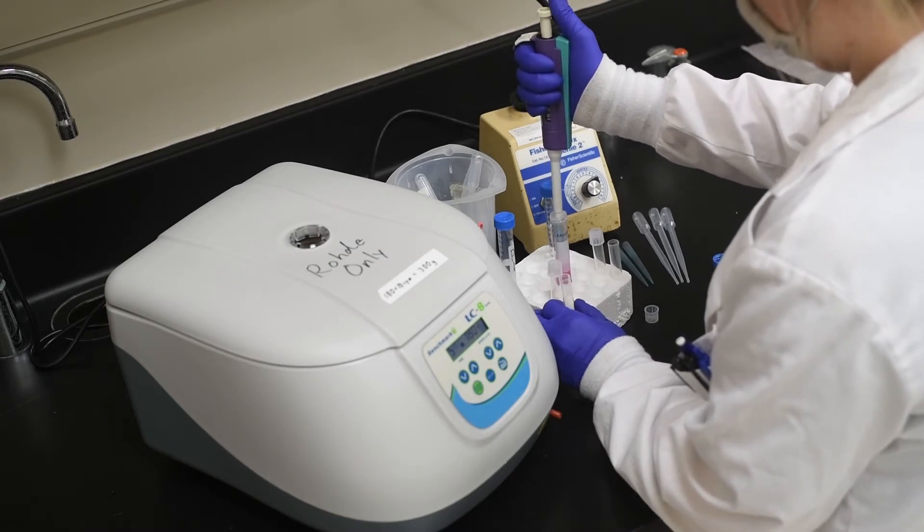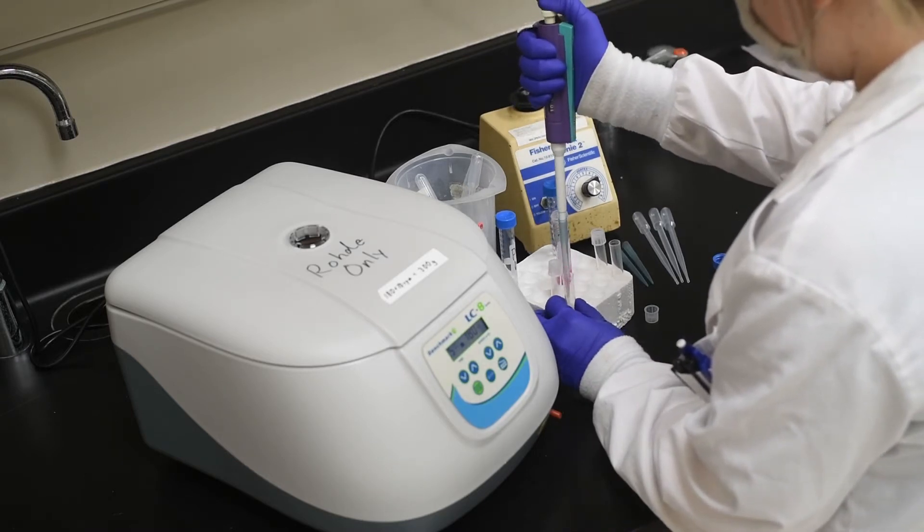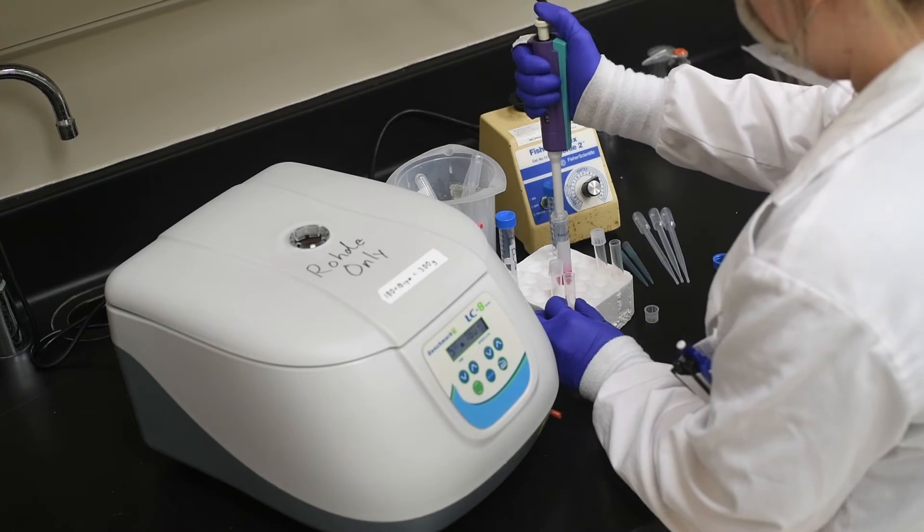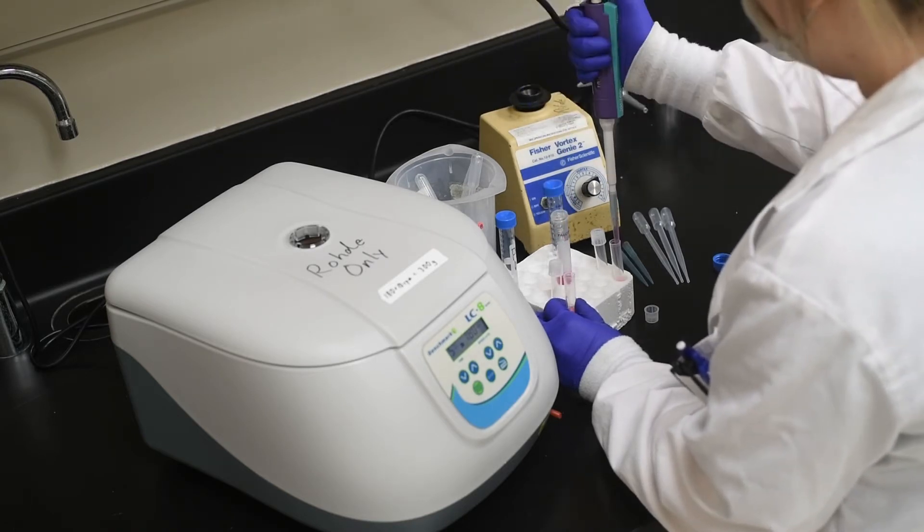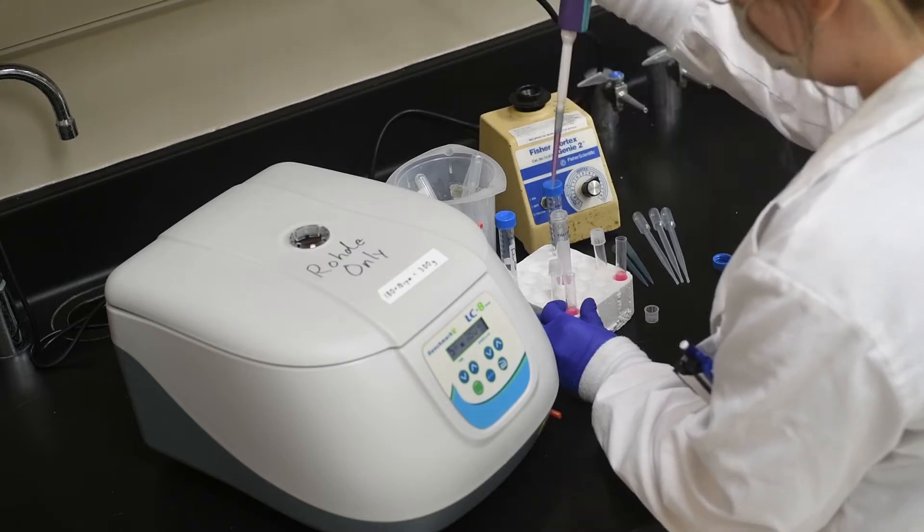You should have between 10,000 and 10 million cells per milliliter of media. The minimum number of cells to be fixed in ethanol for this experiment is 1 million cells per tube as determined by the Muse analyzer.